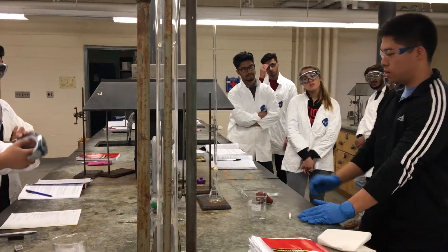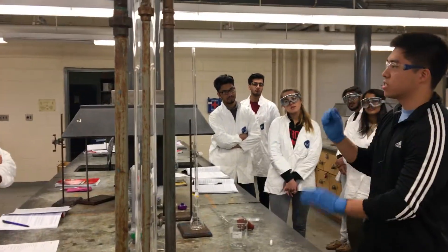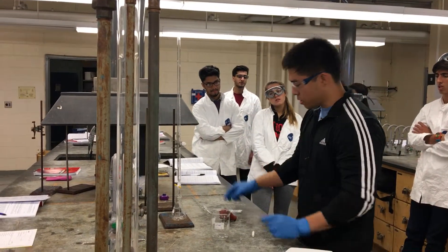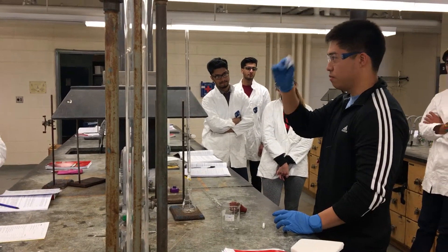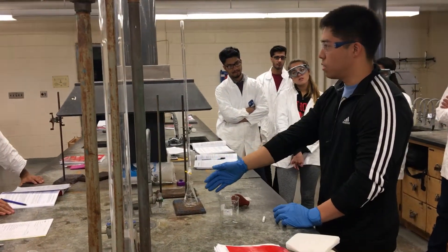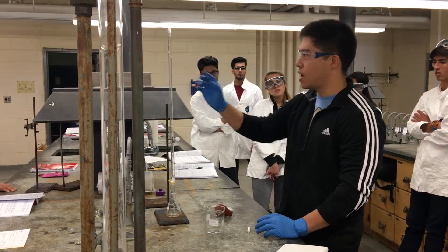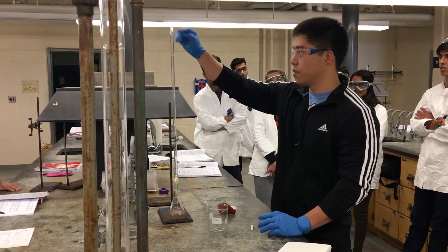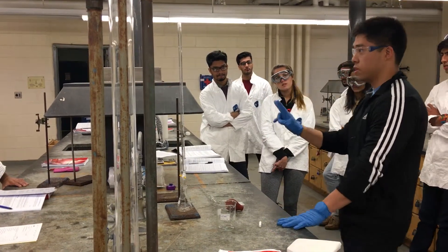Then wash your Erlenmeyer flask — it does not have to be dry, just very clean — and now you're going to do a second trial. Measure the tablet, crush it, measure it again, add 40 mL of DI water and 25 mL of acid. You should not have to refill the NaOH — if you filled it up all the way to zero, that should be more than enough to perform both trials.